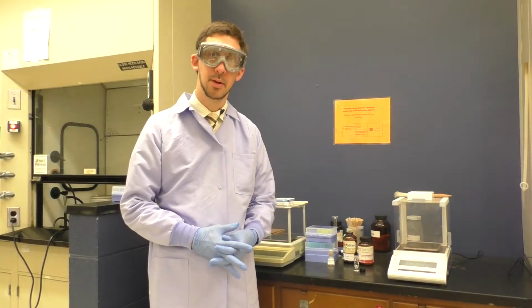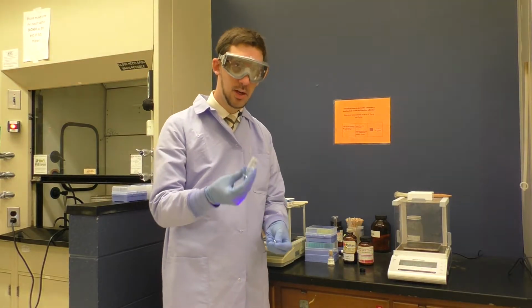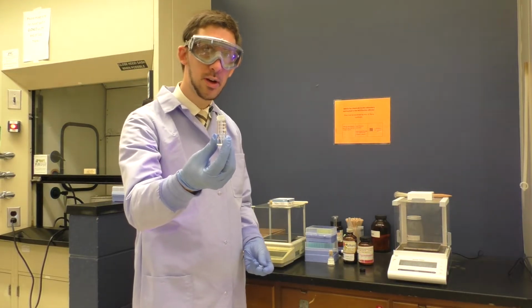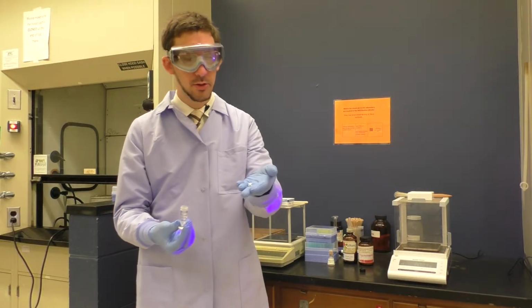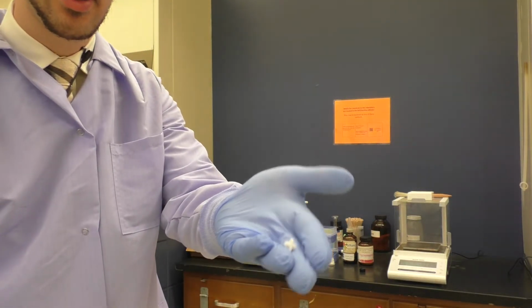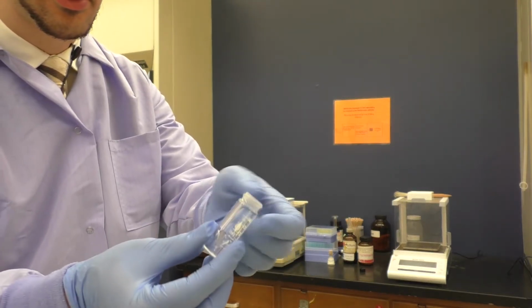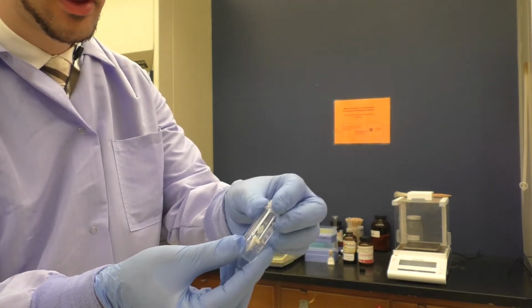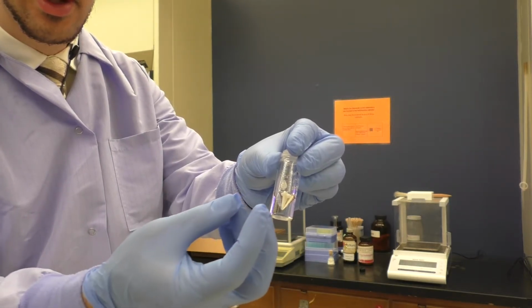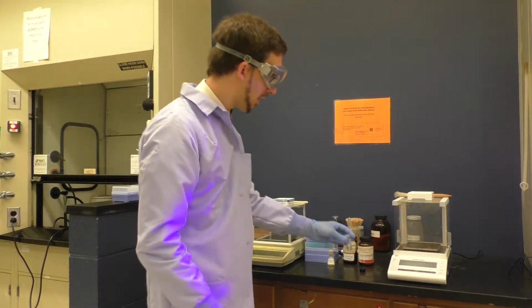Here we are in lab. I have a 5 ml conical vial right here where I will perform the reduction. I have this small spin vane. Might be a little bit difficult to see, but it's kind of triangular shaped, and it fits well in this conical vial so that it can spin with the not flat bottom, with a sort of cone-shaped bottom. So I'll perform the reaction in that.